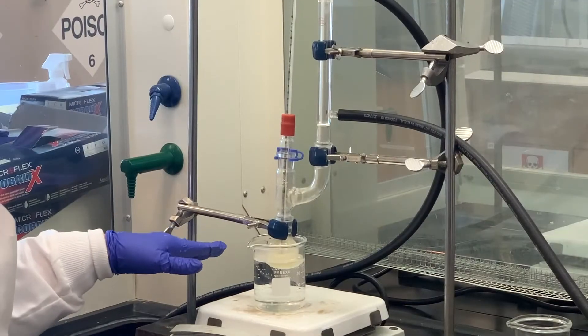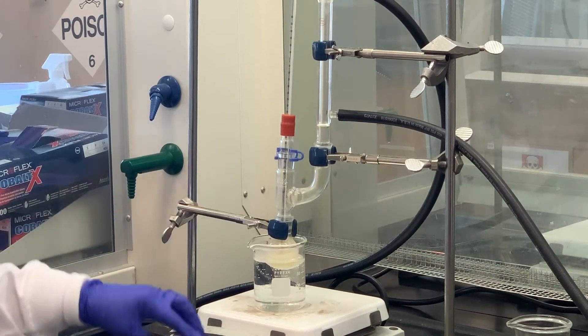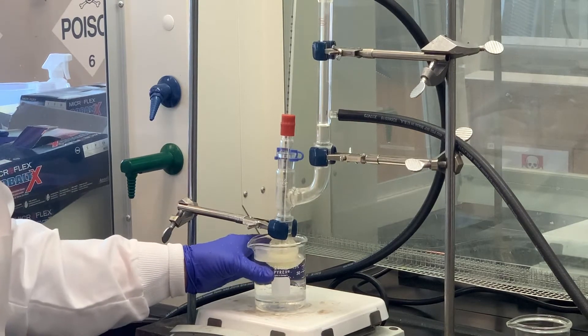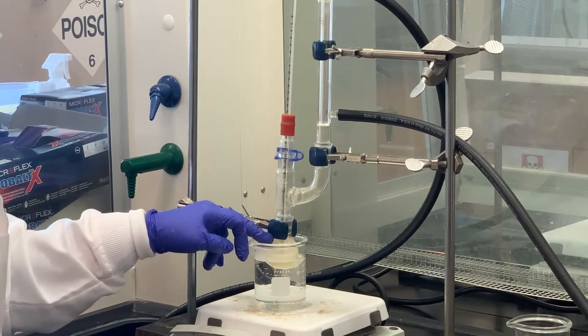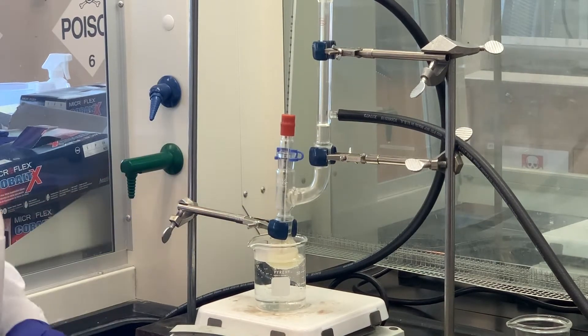It's been 15 minutes, heating around 50 to 55 degrees. So what we're going to do now is turn off the heat. I'll raise this a little bit so it can cool down a bit more, and we'll let that cool to room temperature. We're going to pour the contents of this flask into some cold water and then work with it from there.